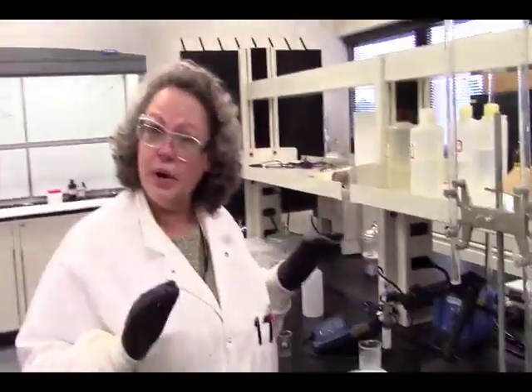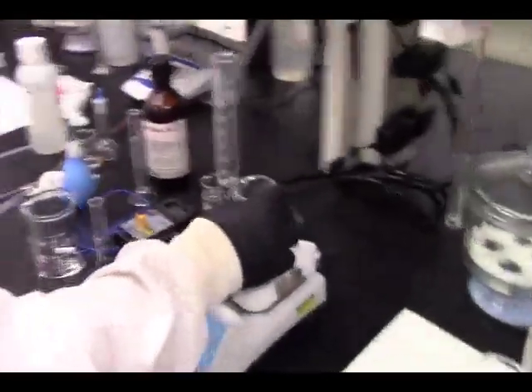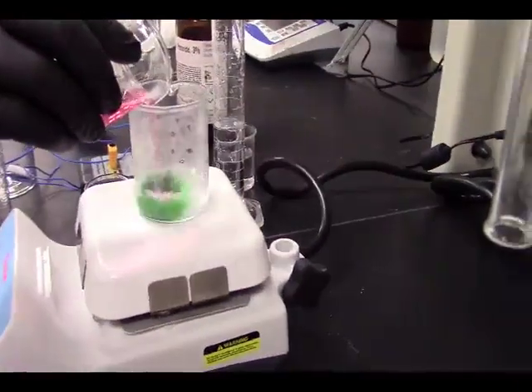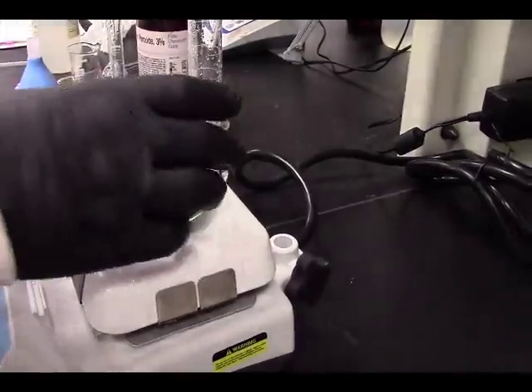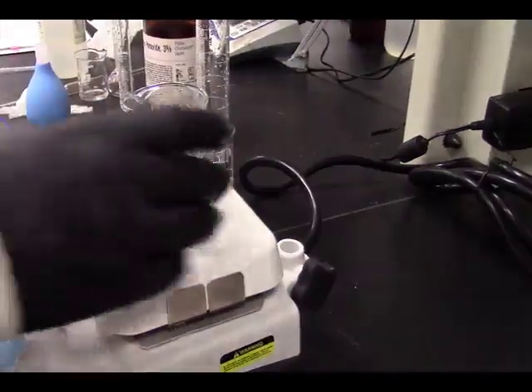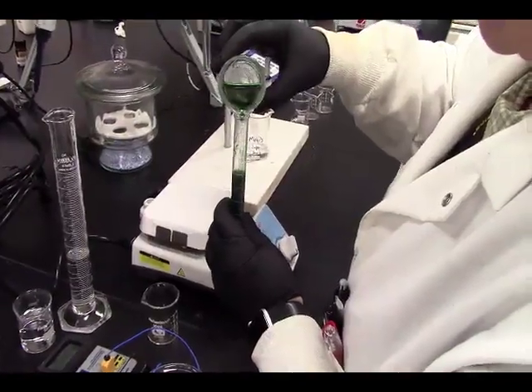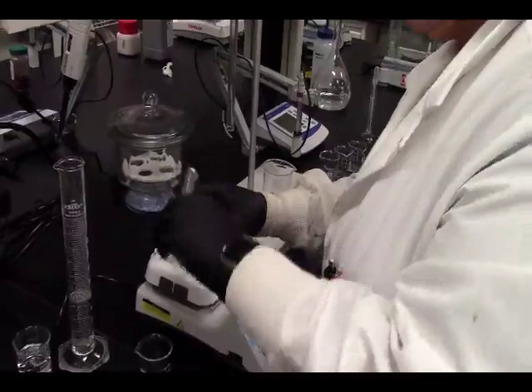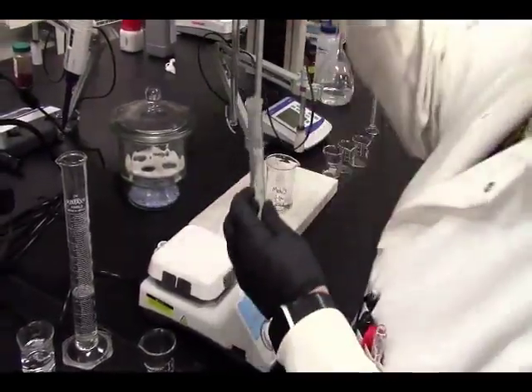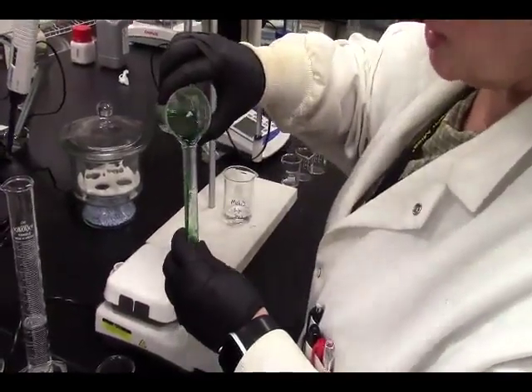All right, so if this turns dark brown or black, it's bad. This is the color of our first one. We're going to see if we can match that one. All right, so let's go. We're still stirring. We're going to add this. Woo! There's no more bubbling, so we're going to take 10 mils. Ooh, is it still bubbling? Oh, it is. I don't see any bubbles now, but it's really dark. It's hard to tell.